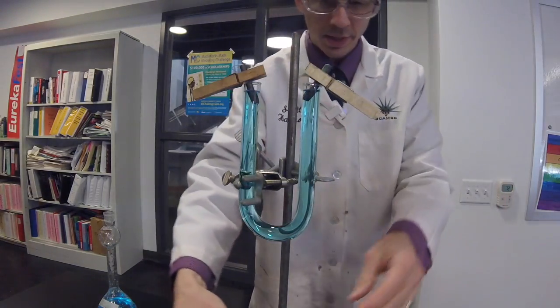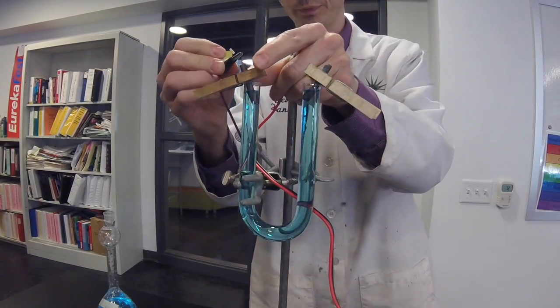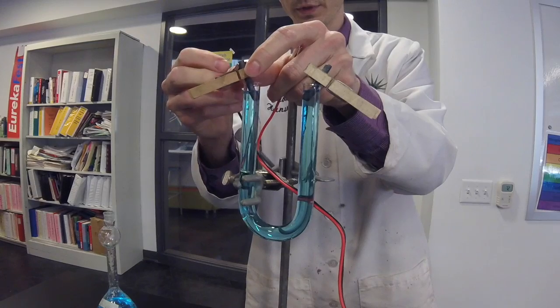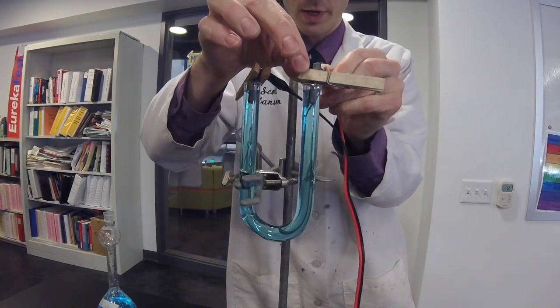Okay, and then I'm going to attach a red wire and a black wire. So there's the black wire and here's the red wire.